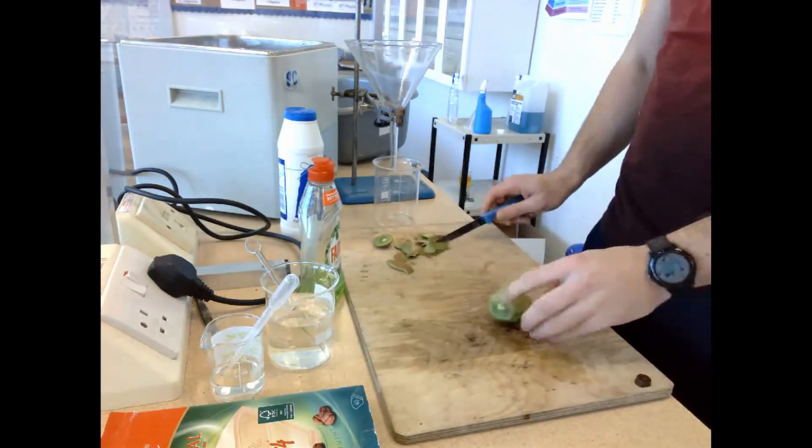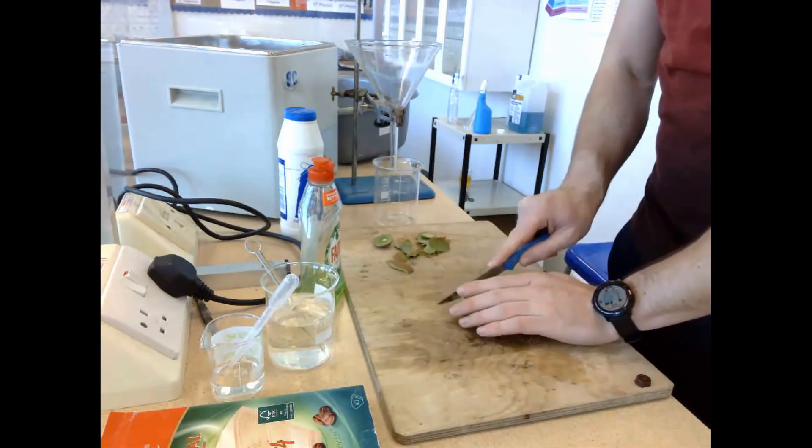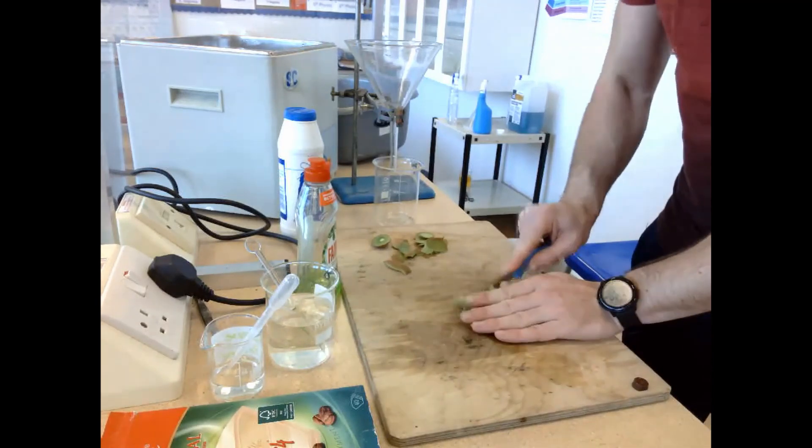The very important thing to note here is you need to know why each individual step is being done in this experiment, because they all play a vital role in releasing out the DNA.